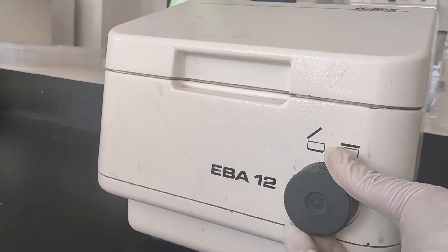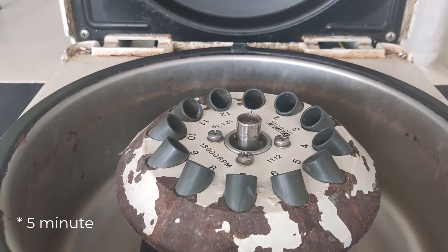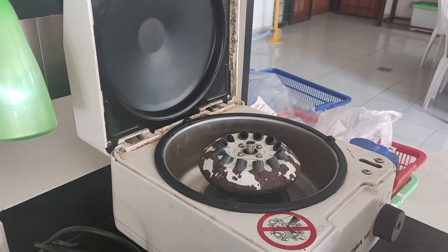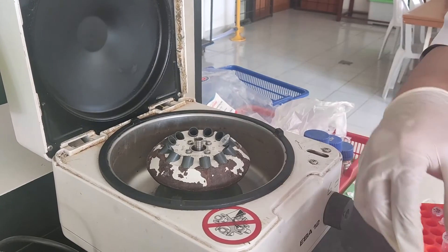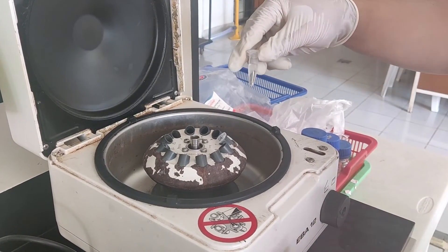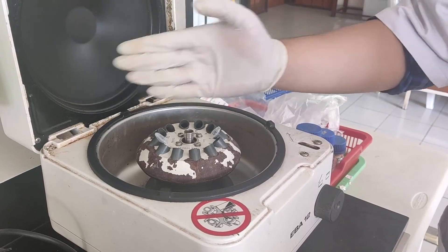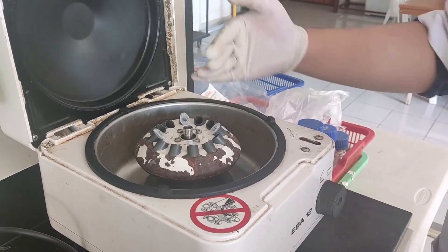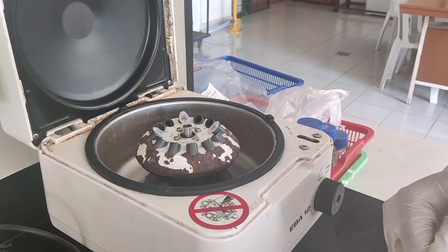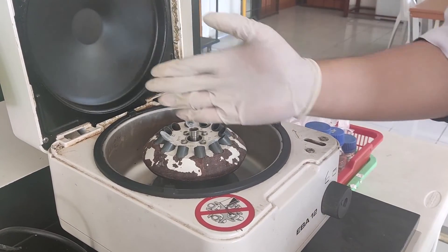After we set the RPM and the time, we can open the lid by turning the knob in front. Here we use 14,000 RPM with a three-minute time. There is a rotor unit — we put the sample inside the rotor. It needs to be balanced face to face with the same volume. For two samples, put them face to face. You can also put three samples but they need to be balanced.